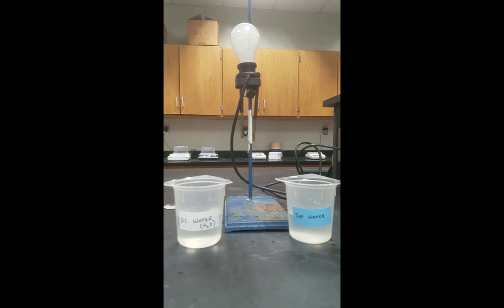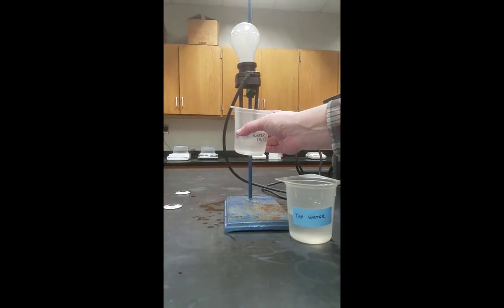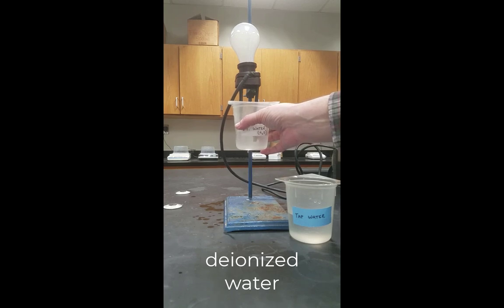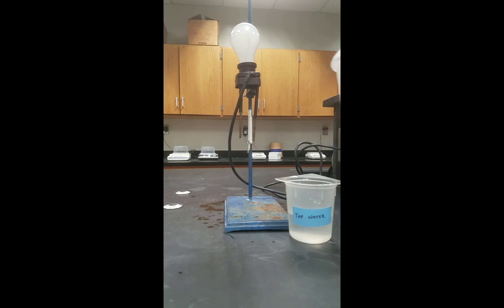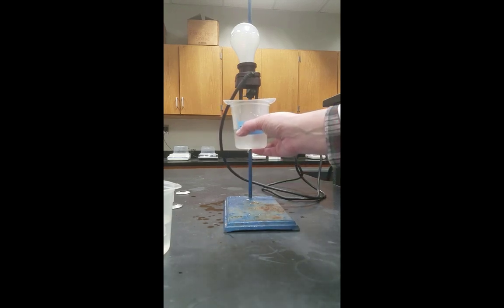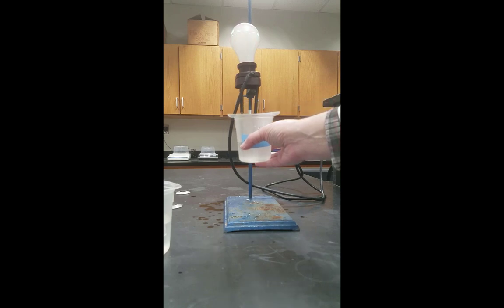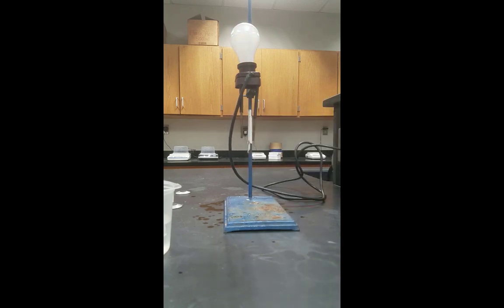Now, although it's not on the report sheet, let's take a look at what happens when we test deionized water and tap water. You'll notice that pure deionized water does not conduct an electric current at all. Tap water, on the other hand, you'll recall, has various ions dissolved in it. And so it does glow very, very weakly. Some of the ions in there would include some calcium ion and magnesium ion, and chloride and fluoride.